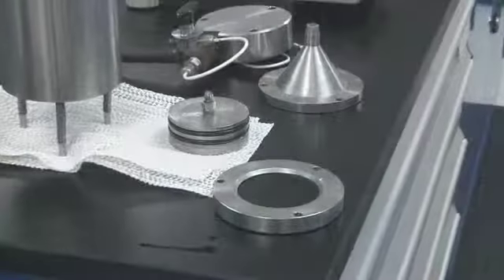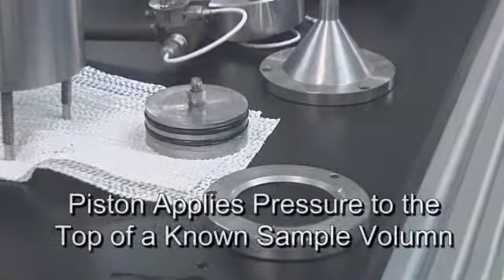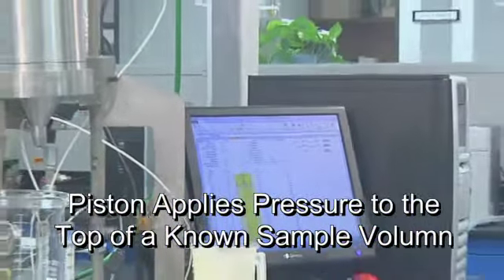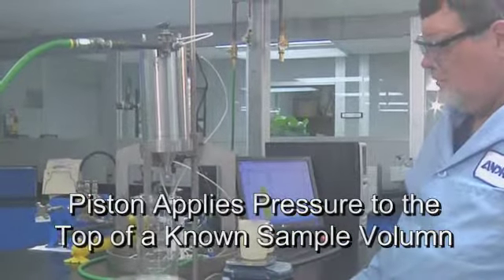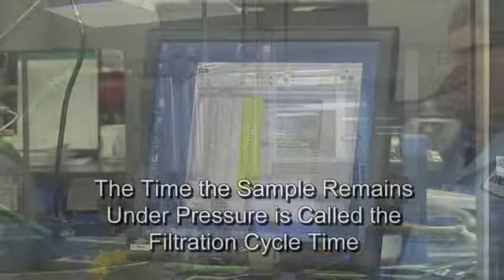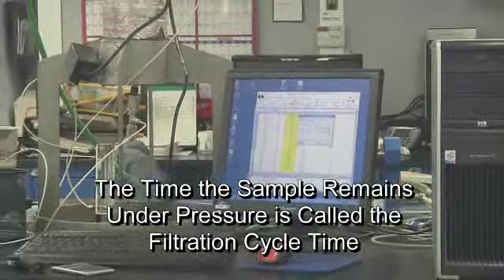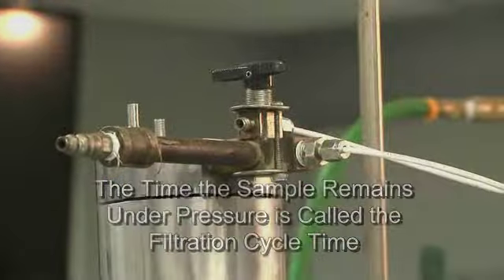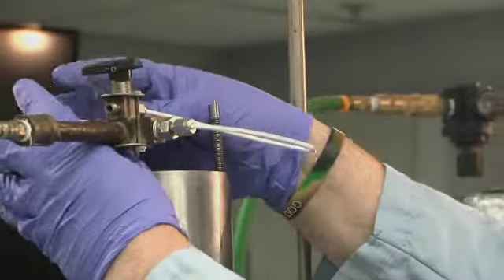To simulate a membrane plate filter press, the piston applies pressure to the top of a known sample volume inside the vessel. The pressure forces filtrate through the solids, which are retained by a filter cloth. The filtrate's cumulative volume versus time is measured for both the recessed and membrane plate simulation. Cake forms as the filtrate passes through the filter cloth.